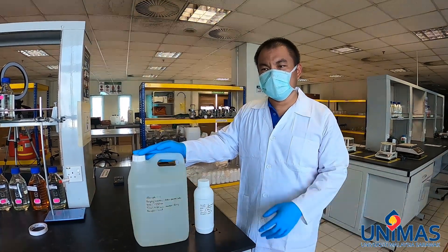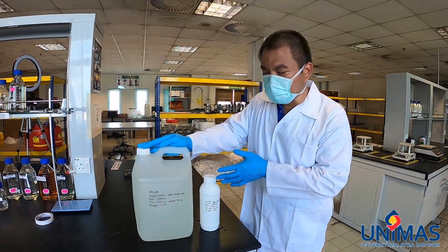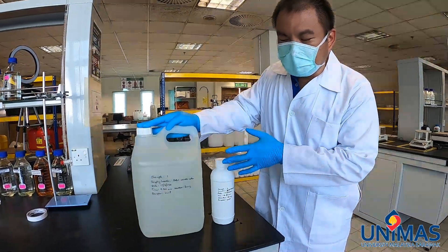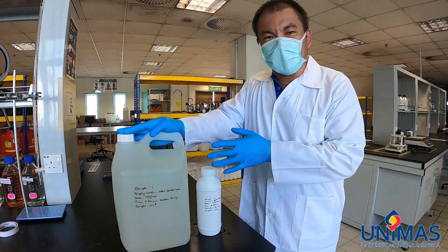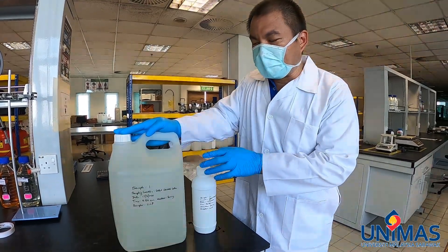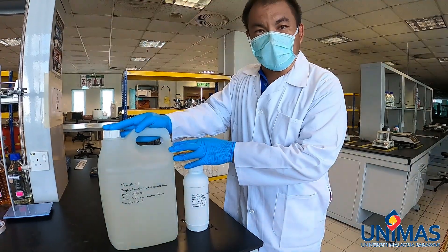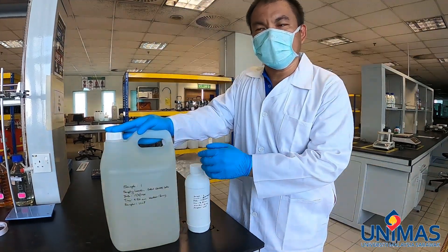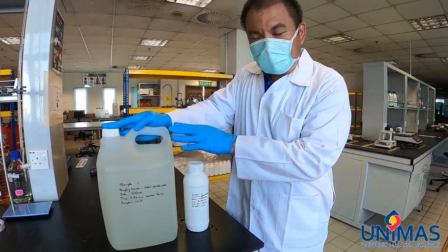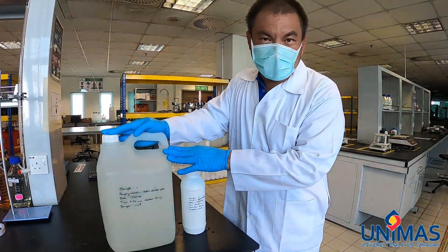We just brought the sample back from the site. As of right now it's 10:15, which is just slightly less than half an hour from the time of sampling. Because of that, we are going to test for BOD first so that we don't need to preserve the sample — either to keep it cold or otherwise. Within 4 hours of sampling, you do not need to do any preservation of the sample.